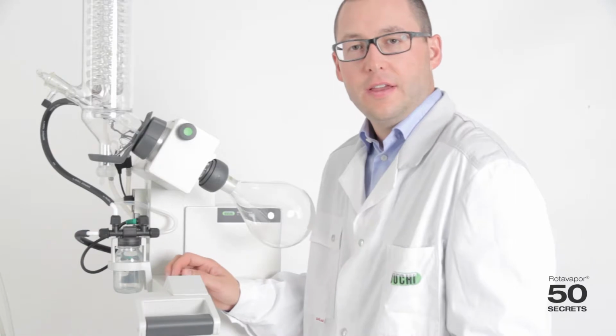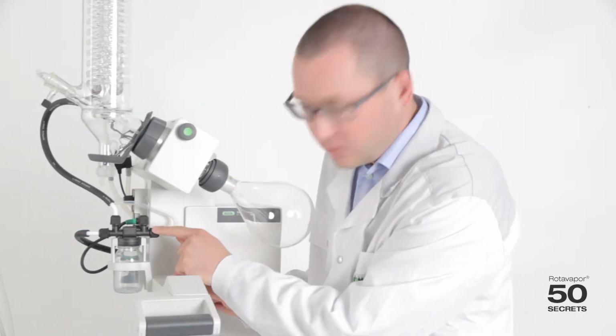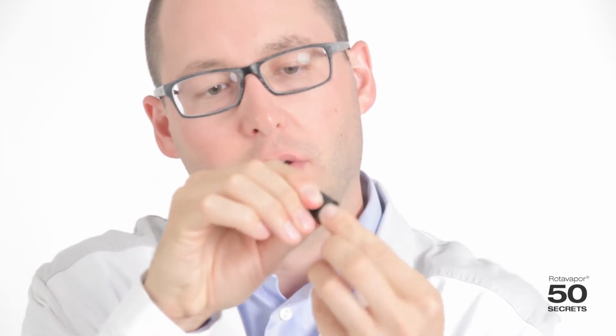Today's secret is all about how to put this tube into this flask. The first step is to put this sealing into the cap. For that, we just use our finger and we put it like this into here and we push it in until it comes out on the other side, like that.